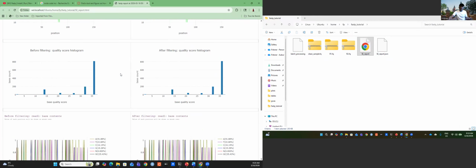It just gives you a kind of summary like the command line. You can go and do this based on your analysis. If you go down here, this is exactly the command that you ran for fastp. If you send this HTML file to someone, they will be able to run the same fastp and get the same result if the person has the same data that you used. It also gives you the fastp version and when we did the analysis.